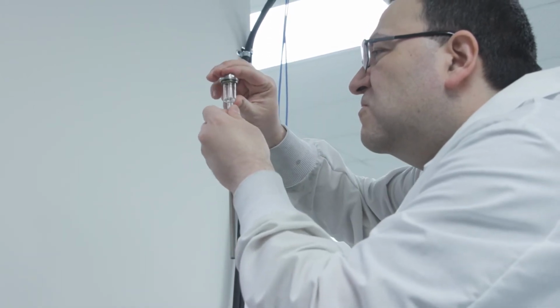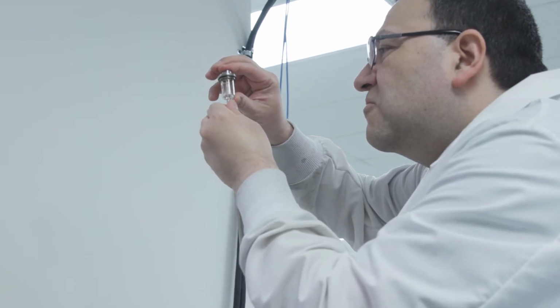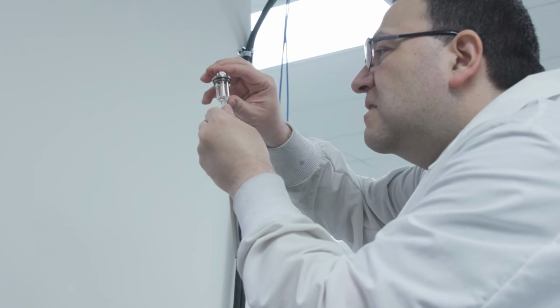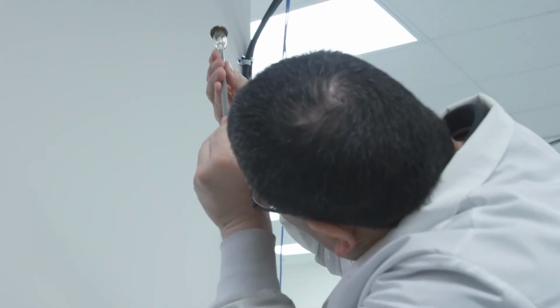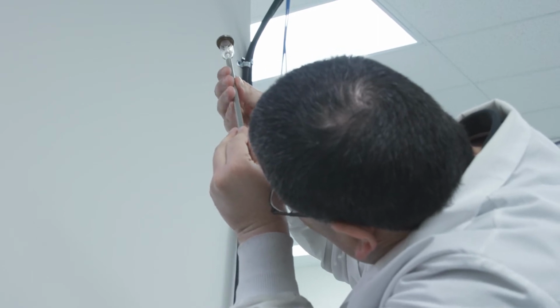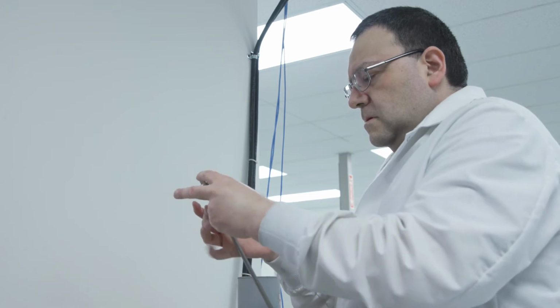He verifies that the cap is properly aligned on top of the penetrometer and checks for a uniform seal by looking through the penetrometer at the sealing surface. Now he adds the sealing nut and tightens it snugly.